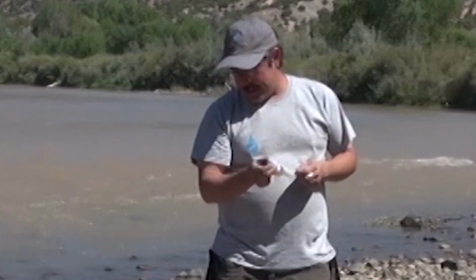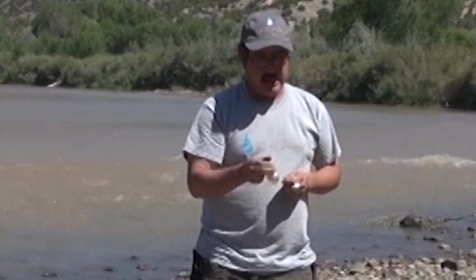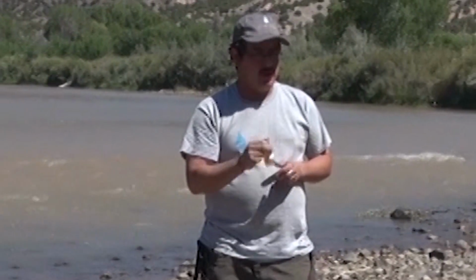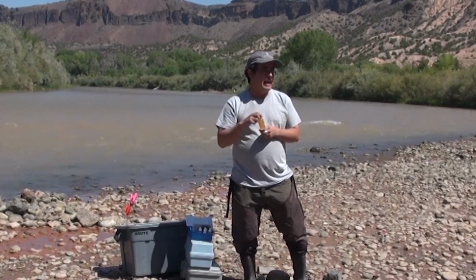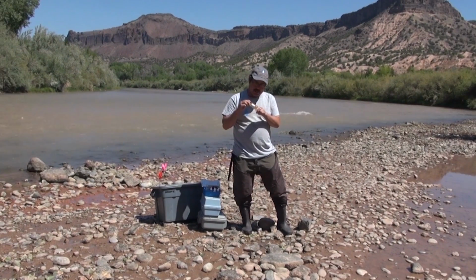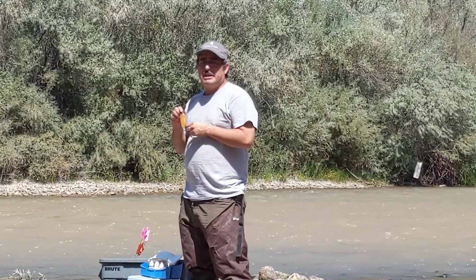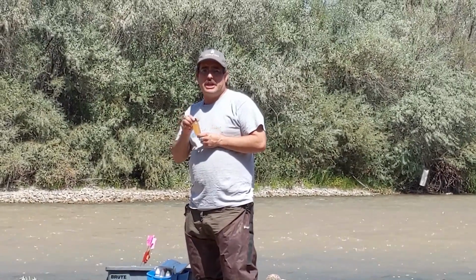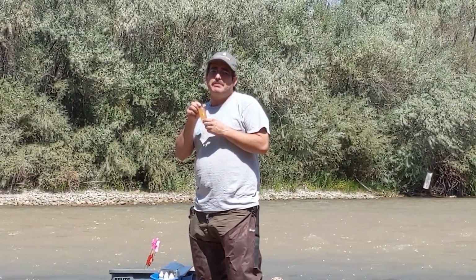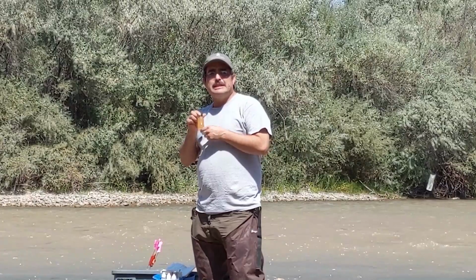So after I've added the manganese sulfate and the alkali potassium iodide azide, I shake up my sample really well. What you're going to notice is that the sample turns something that looks a lot like apple juice, or apple juice with floaties, I like to call it. I like to see these different color changes when I'm running this test, because then it tells me that I'm running the test properly. If you do not see these color changes that I'm going to go through with you guys, then that means that maybe you made an error. Remember, it is okay, if you're not sure you did something properly, to run the test again.